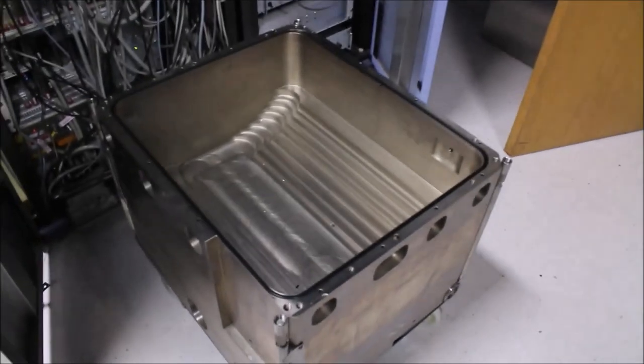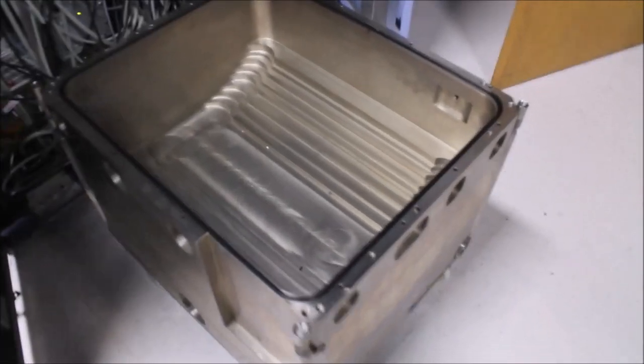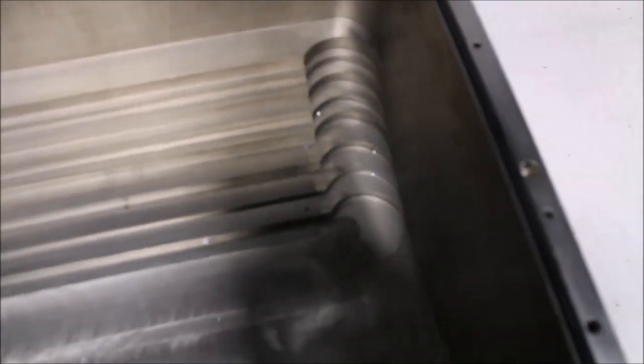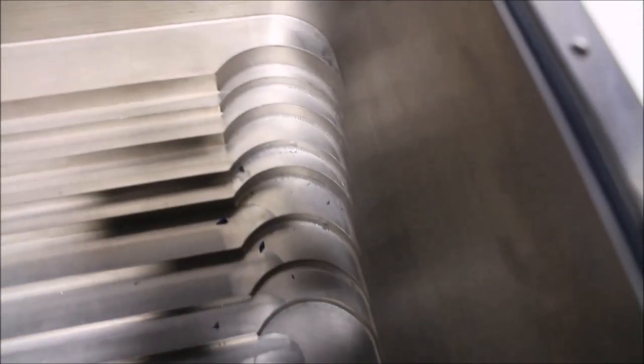Next step is going to be to reinstall the sump. Since we have the sump out, it's also a good time to clean out all the particles that might be in there. Look, we've got a bunch of broken wafer fragments in here that we should vacuum out carefully.